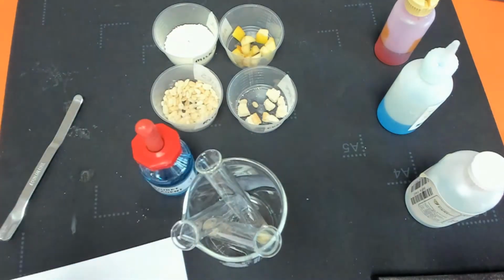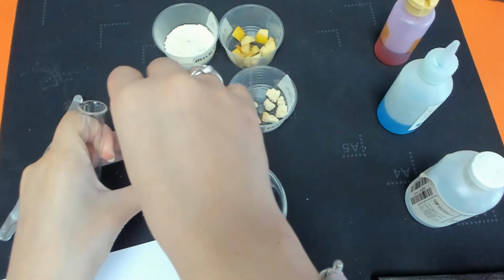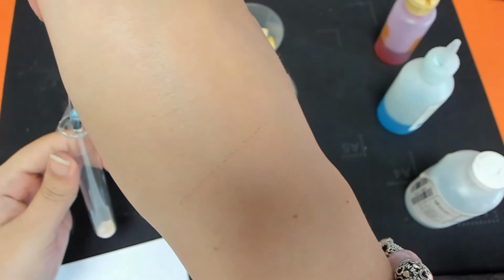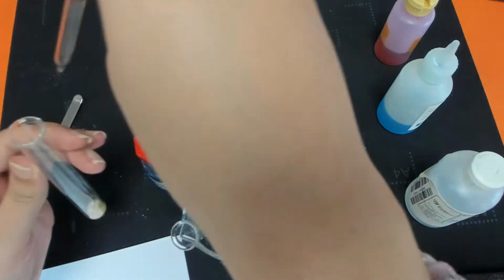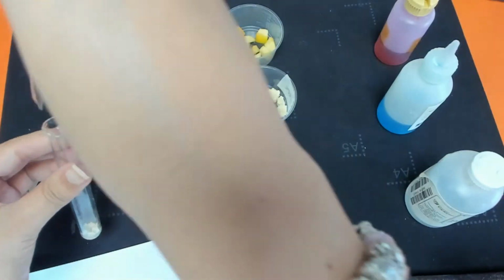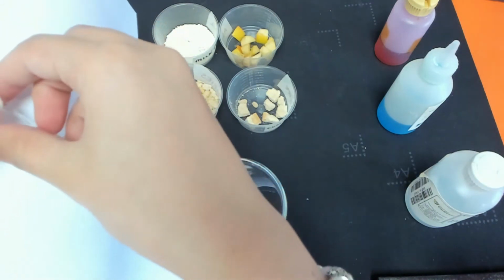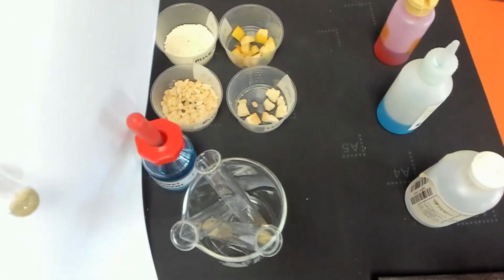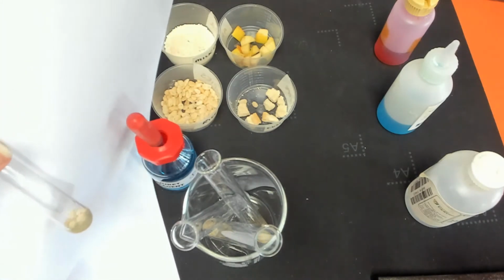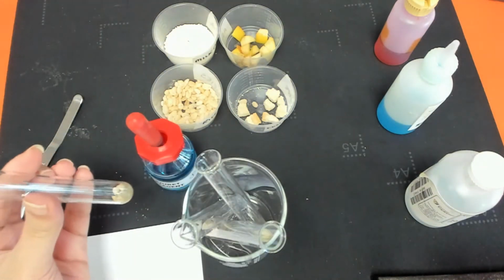Let's do Rice Krispies next. So we've got a cereal here, and we're trying to find out whether or not it's got any proteins in it. I can see something happening here, but I don't think it's a colour change to purple. I think what that Biuret solution or reagent has done is just kind of stained the Rice Krispies, it's not actually changed it to purple. So therefore we would stick to calling that a negative test.